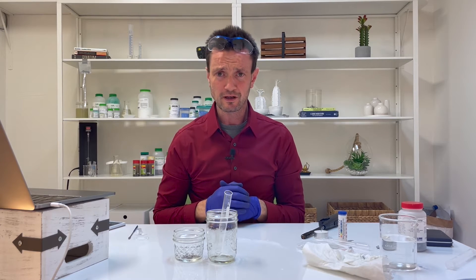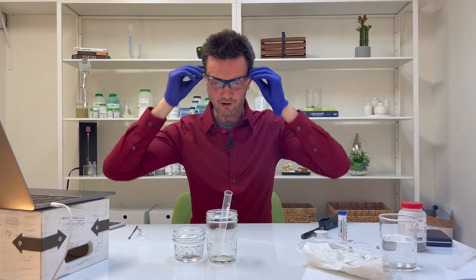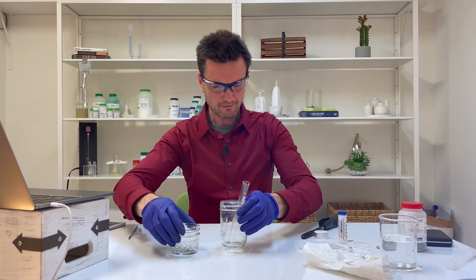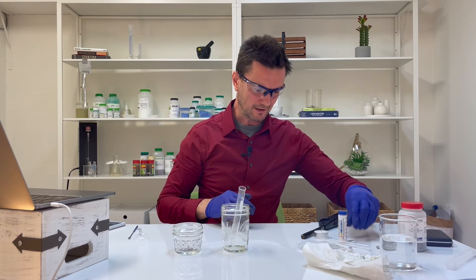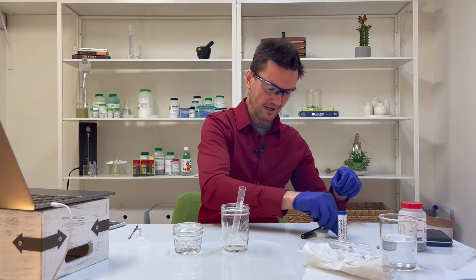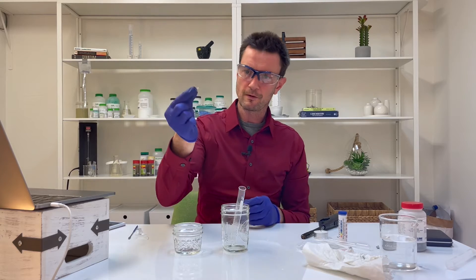For this experiment, I'm going to ask you to wear gloves and goggles — that should be a small hint of what's about to happen. For the magnesium, it's very similar to the vinegar experiment.